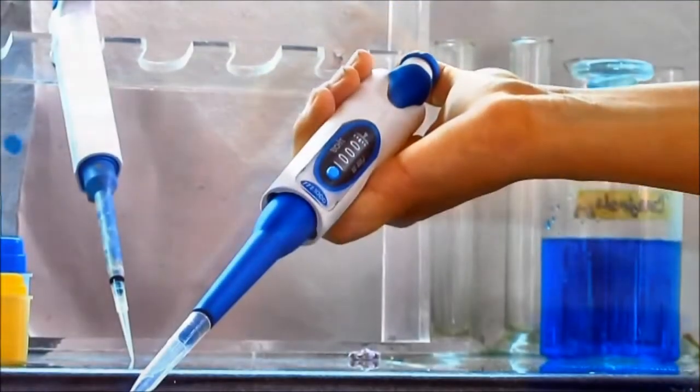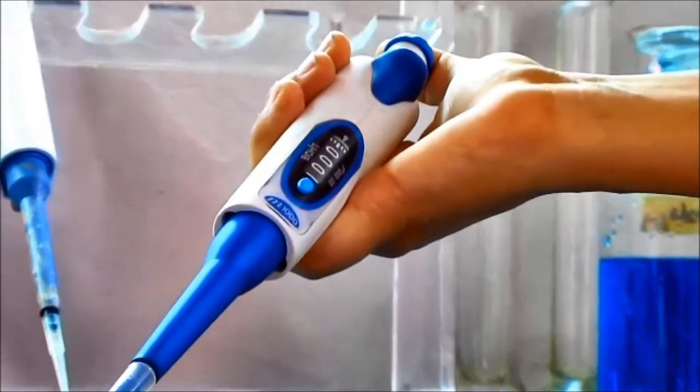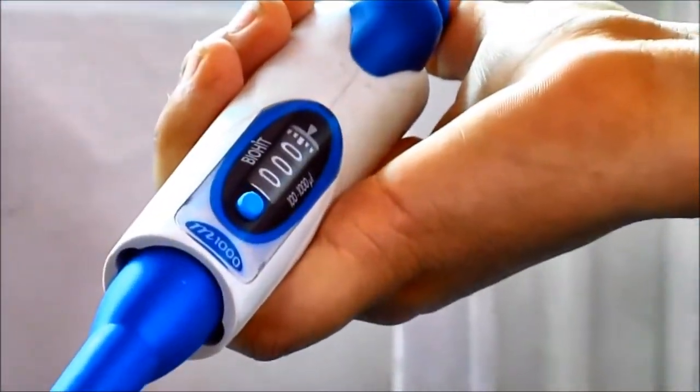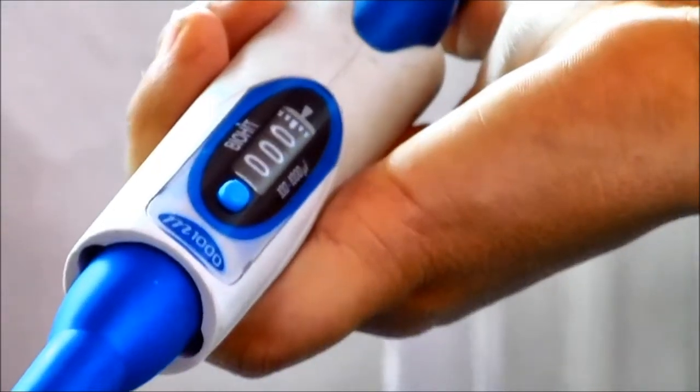This is another automatic micropipette. This micropipette has a lower limit of 100 microlitre and an upper limit of 1000 microlitre.